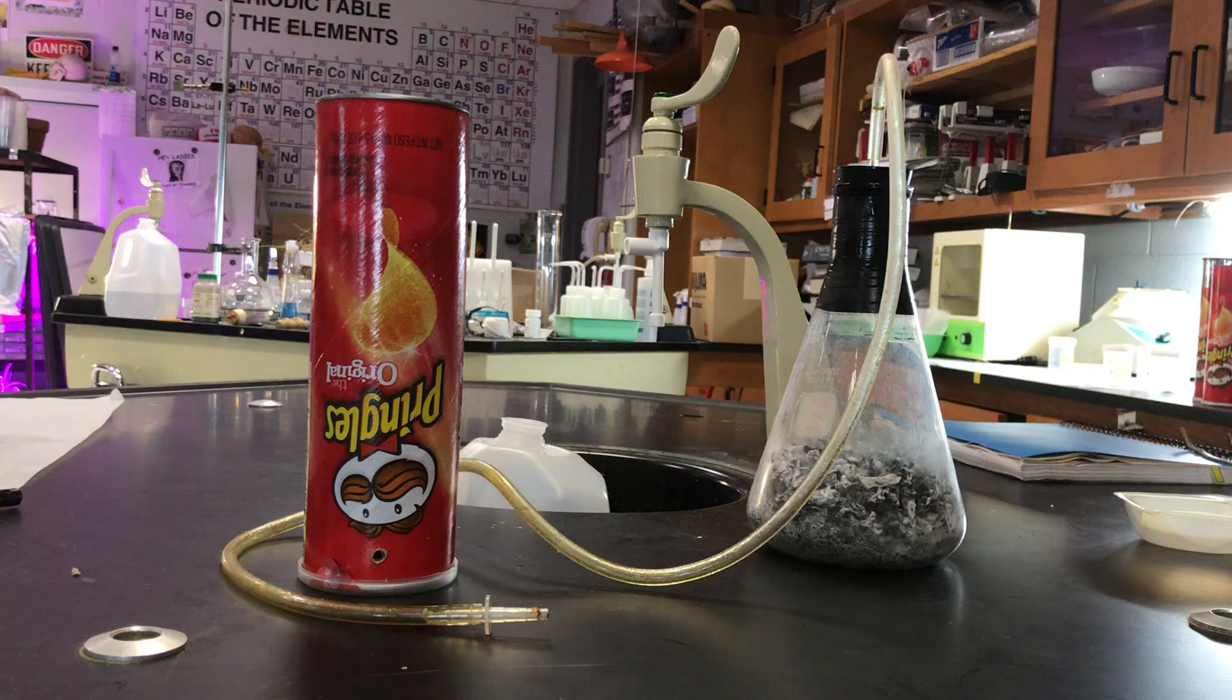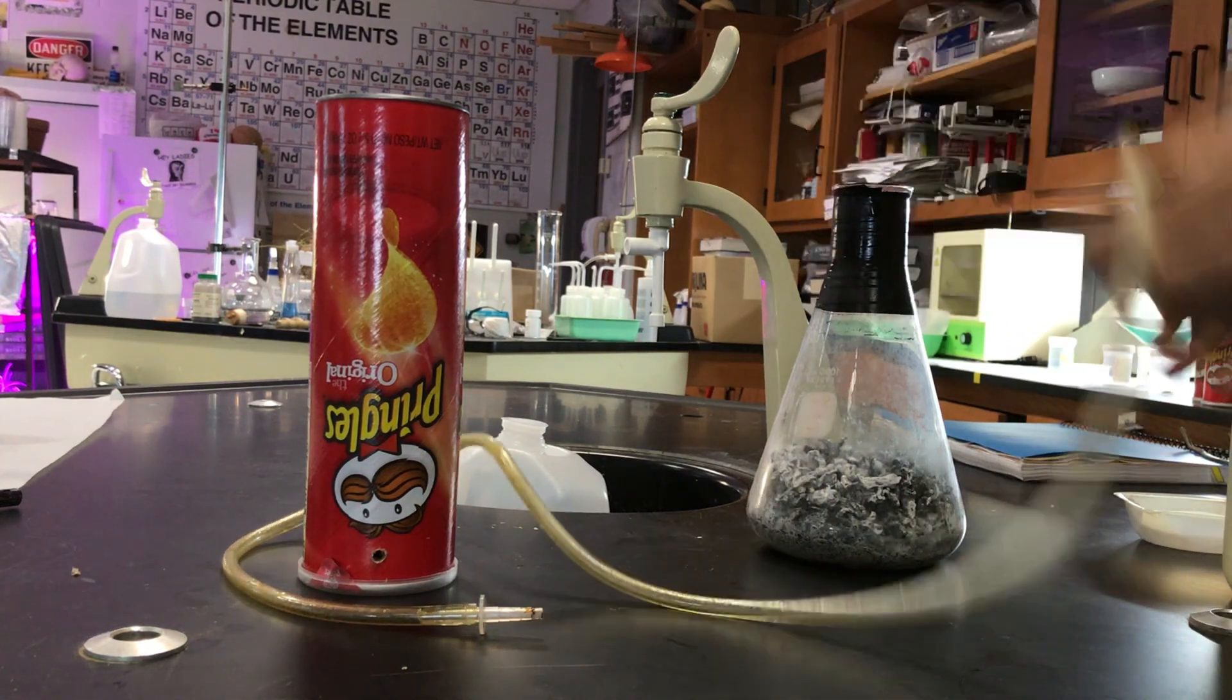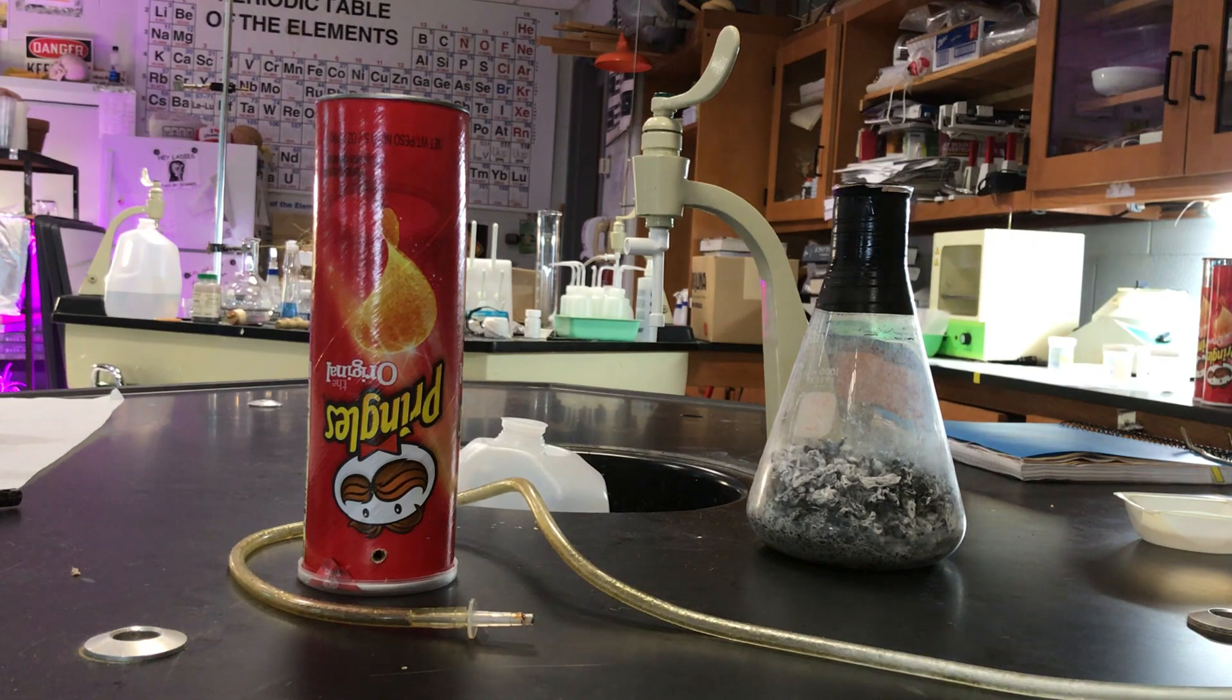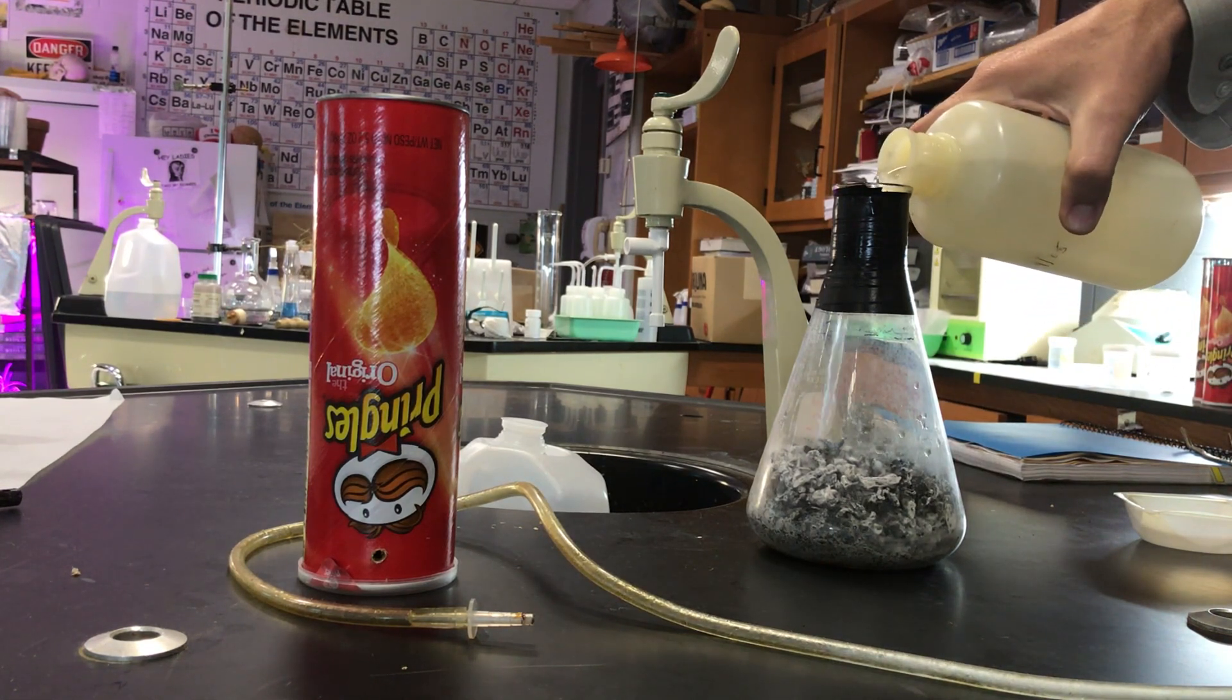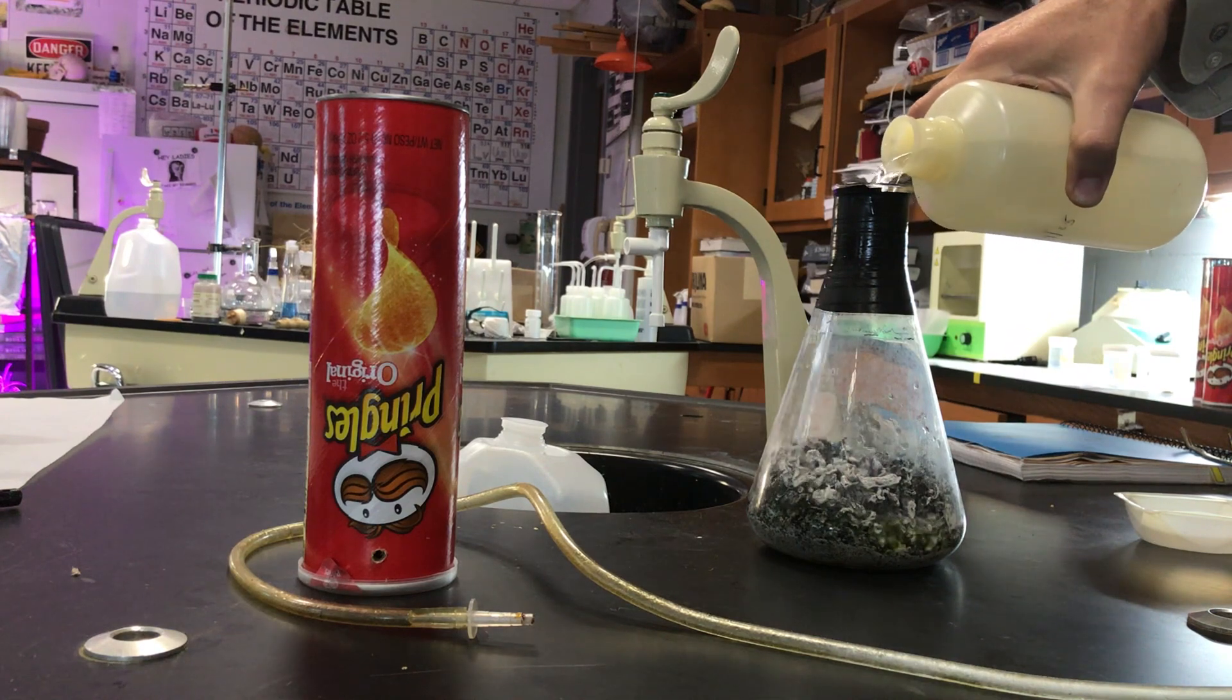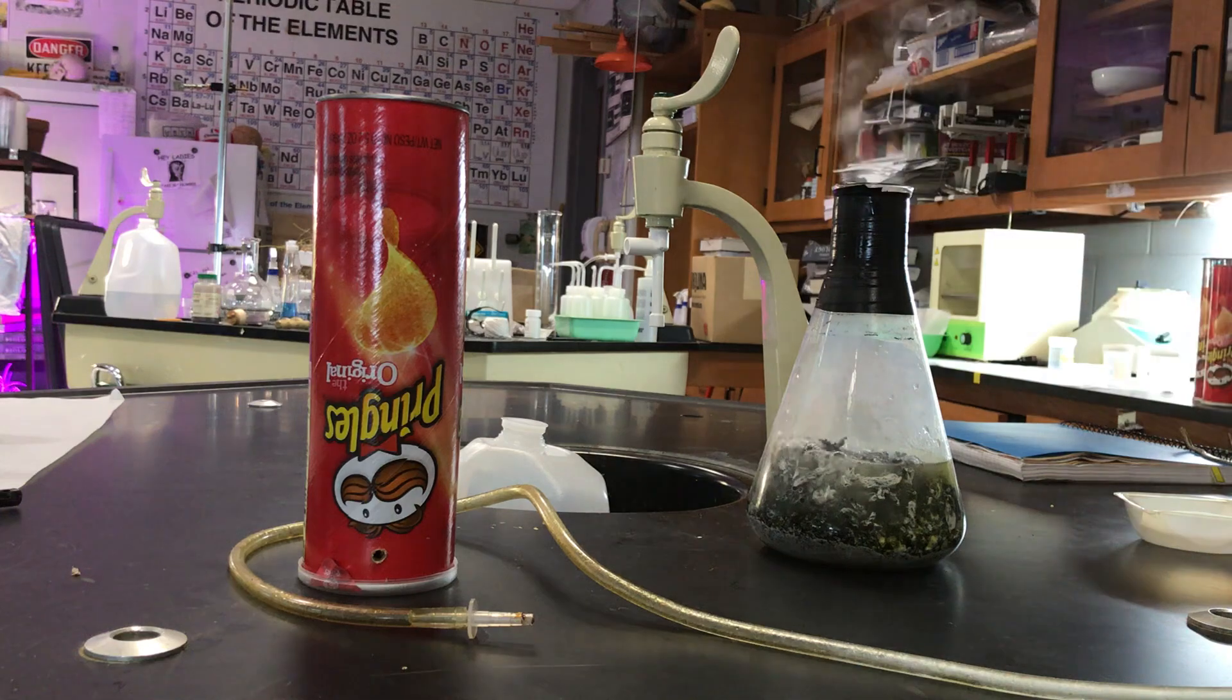I'm gonna take some hydrochloric acid and pour it onto my zinc. The H+ ions will pull electrons from my zinc, and the H+ will grab electrons from the metal and we'll create some gas.